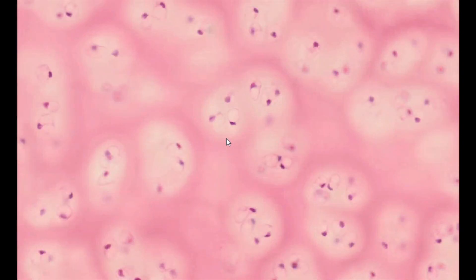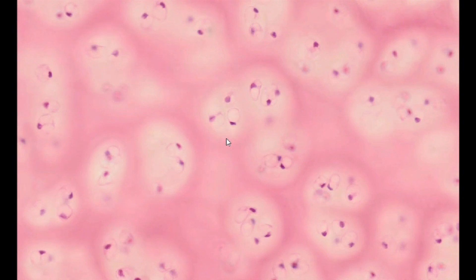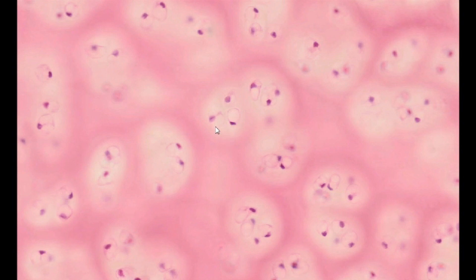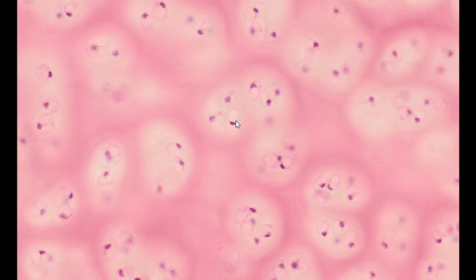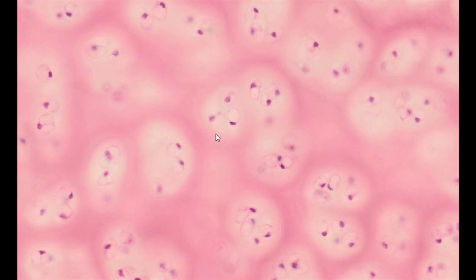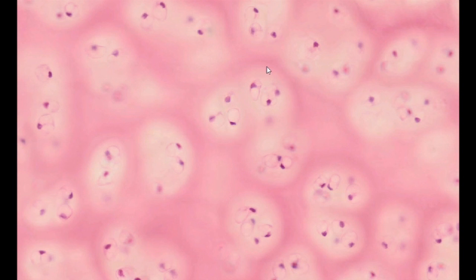Chondrocytes are mature cartilage cells derived from chondroblasts. Chondroblasts, after producing matrix components and secreting them outside the cell, transform into a dormant form and reside in small lacunae as chondrocytes. Occasionally, more than one, but usually no more than four, chondrocytes per lacuna are observed.